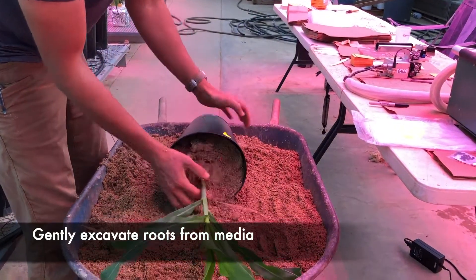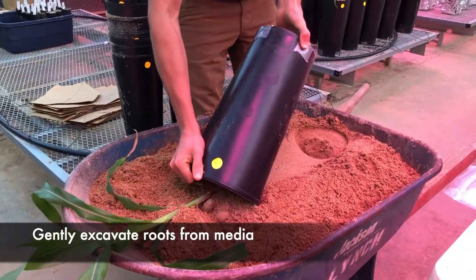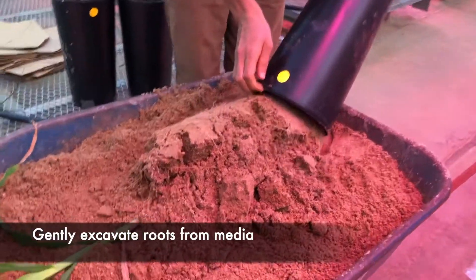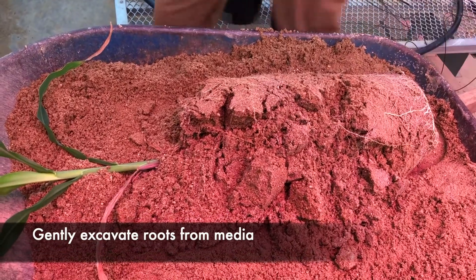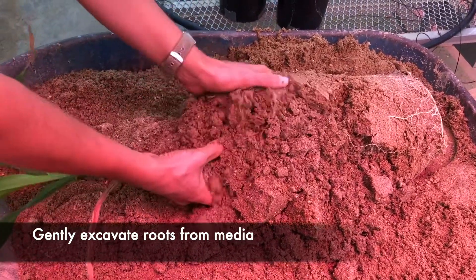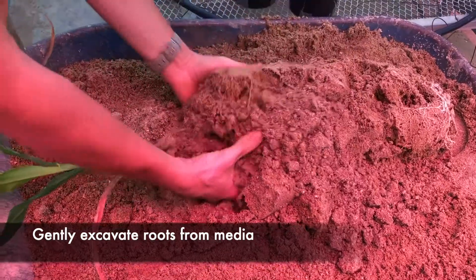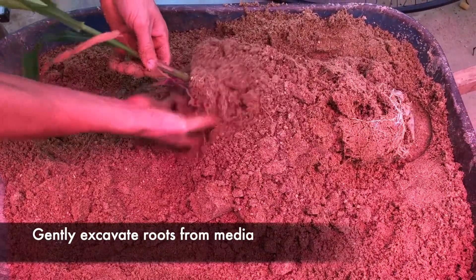To begin our measurement, it is imperative that we work with the freshest root samples possible. We first excavate the intact root system from pots by gently loosening the growth media, making a strong effort to minimize damage to the root system as we excavate. Here we gently shake and pull the roots from the media. Because root tissue will begin to desiccate following excavation, it is important that we work quickly to minimize this effect in our measurements.